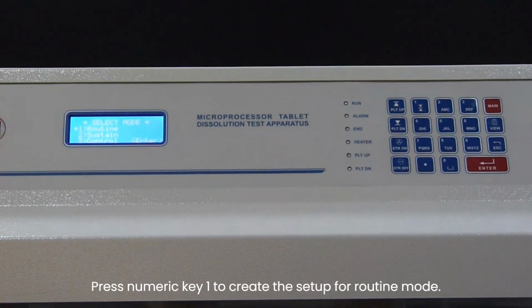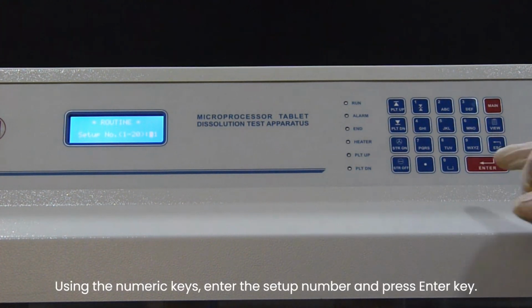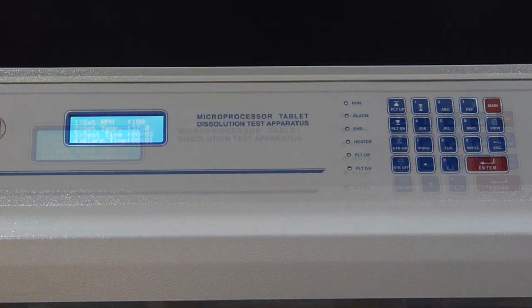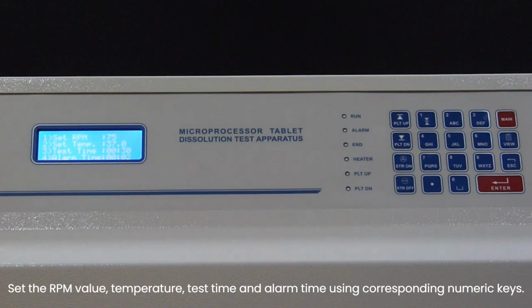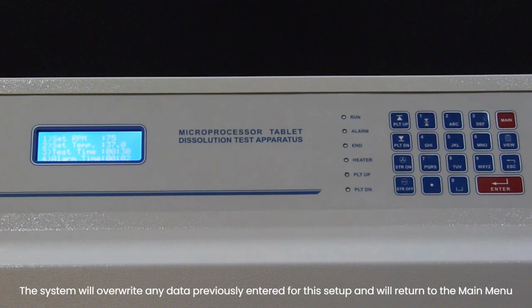Press numeric key 1 to create the setup for routine mode. Using the numeric keys, enter the setup number and press Enter key. The display shows the test parameters for the setup selected in the previous step. Set the RPM value, temperature, test time and alarm time using corresponding numeric keys. After setting the test parameters, press the Enter key. The system will overwrite any data previously entered for this setup and will return to the main menu.